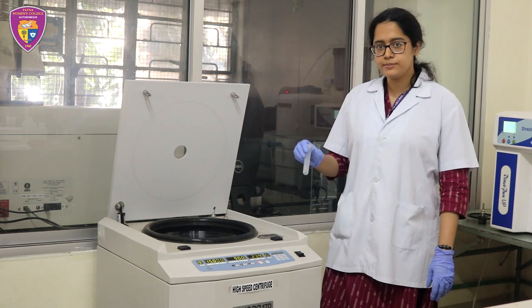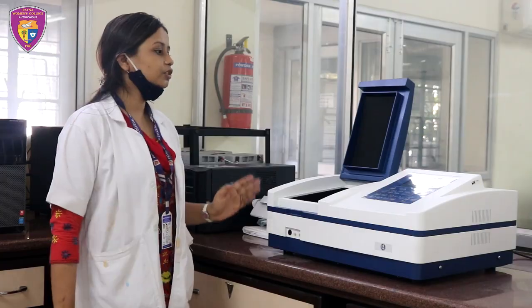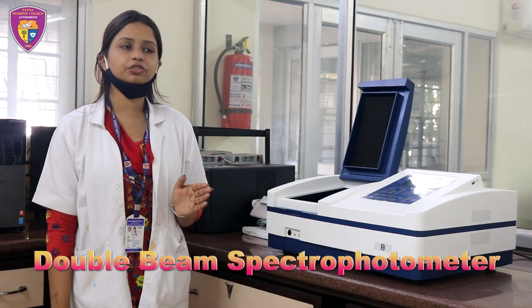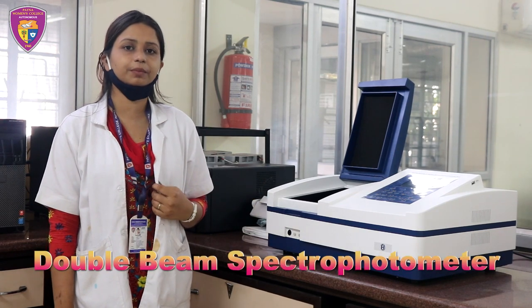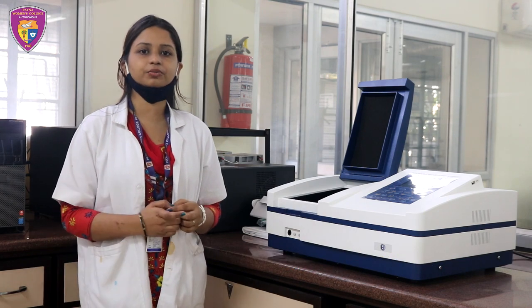Right now I am using this sample to isolate DNA. This machine is a double beam spectrophotometer which utilizes two light beams — one which passes through the sample and another which passes through the reference.